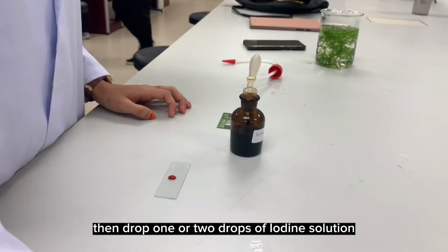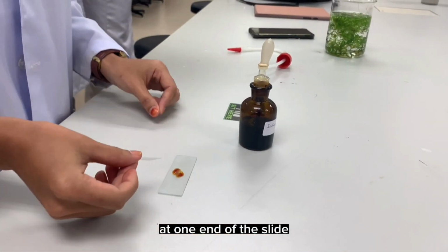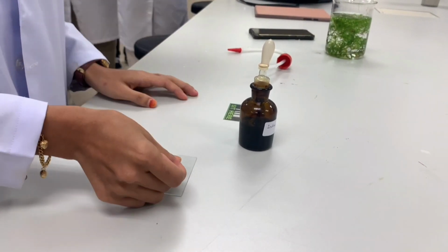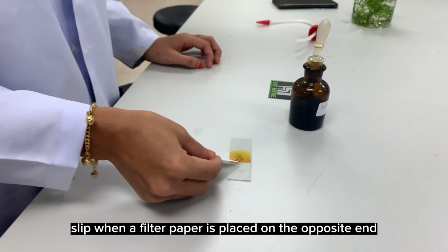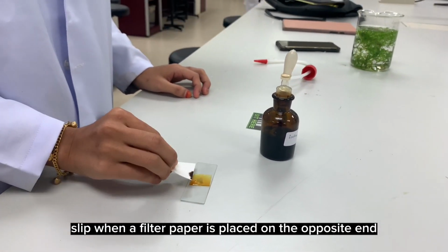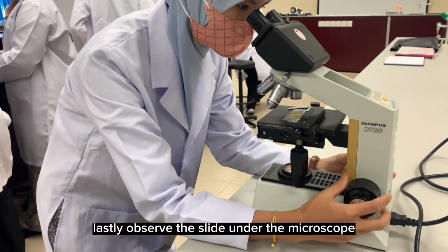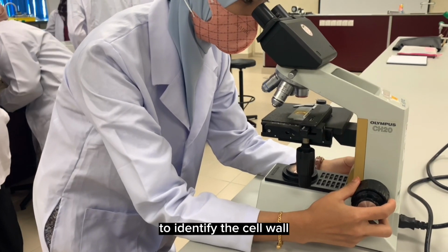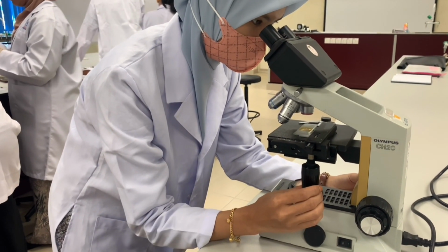Then, drop 1 or 2 drops of iodine solution at one end of the slide. The solution will spread under the cover slip when a filter paper is placed on the opposite end. Lastly, observe the slide under the microscope to identify the cell wall, nucleus, vacuole, and cytoplasm.